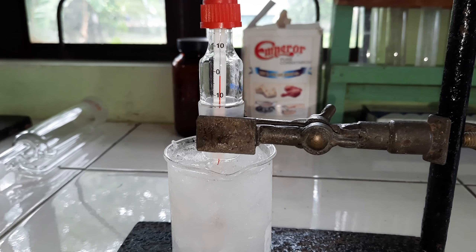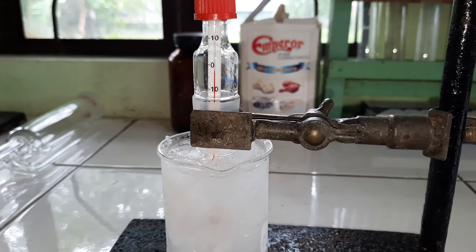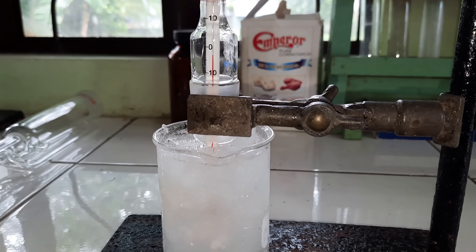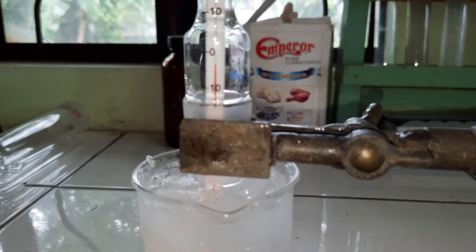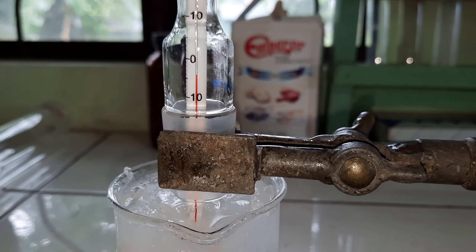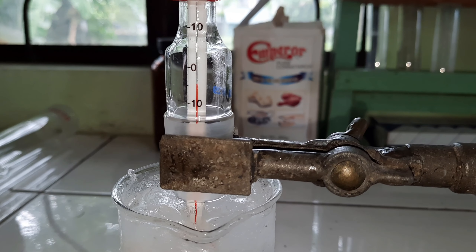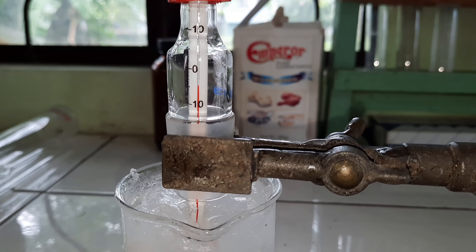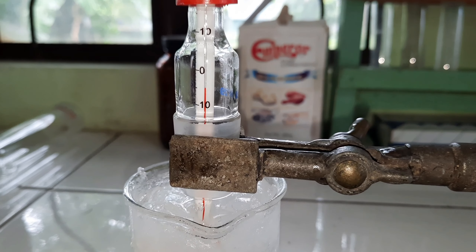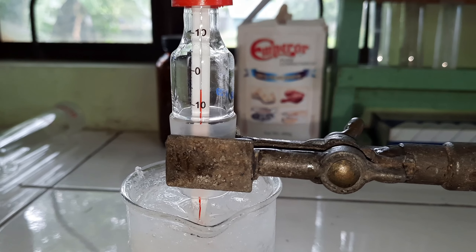Try to note the temperature. Prior to the addition of sodium chloride, water freezes at 0 degrees Celsius. At this point, when sodium chloride is added into the solution, try to note the freezing point — it's going way below 0. It is now registering at about negative 4, going further down to negative 5.